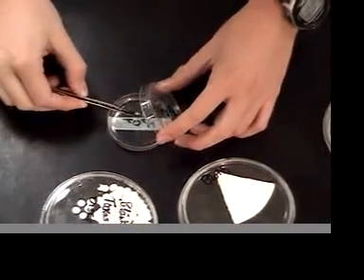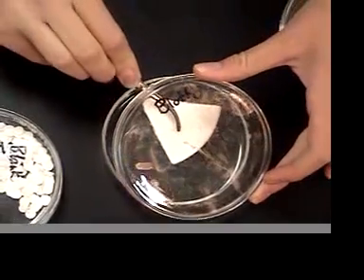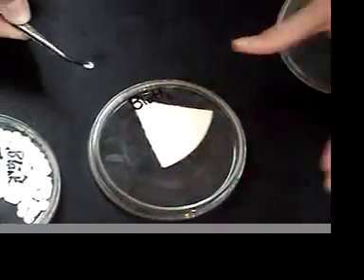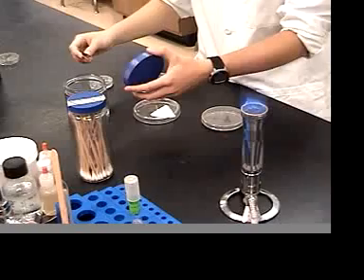Dip the sterile disc into the antiseptic and blot it onto a piece of Whatman filter paper in order to take away any of the excess liquid. Now, place it onto your agar plate and gently tap it down.